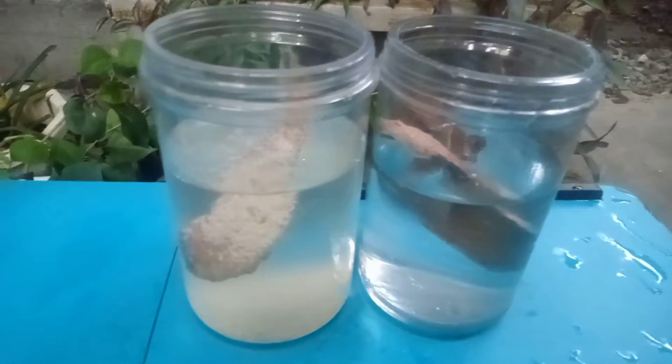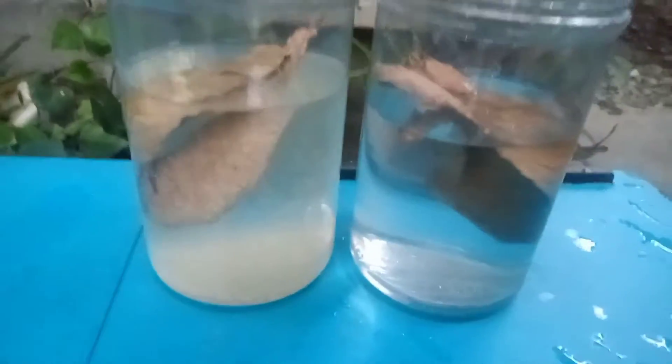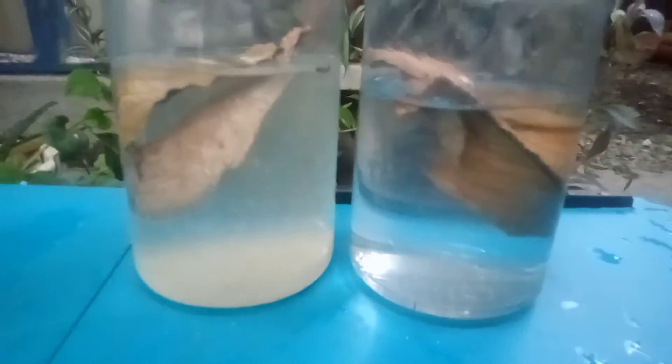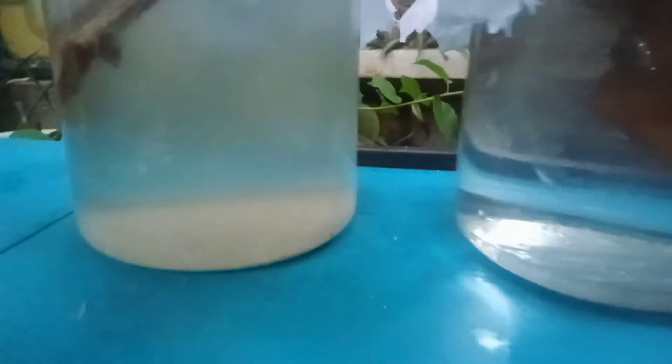You can see that I used two containers, just in case the protists weren't able to live in the other one. Cover it with a white cloth because it will smell awful.